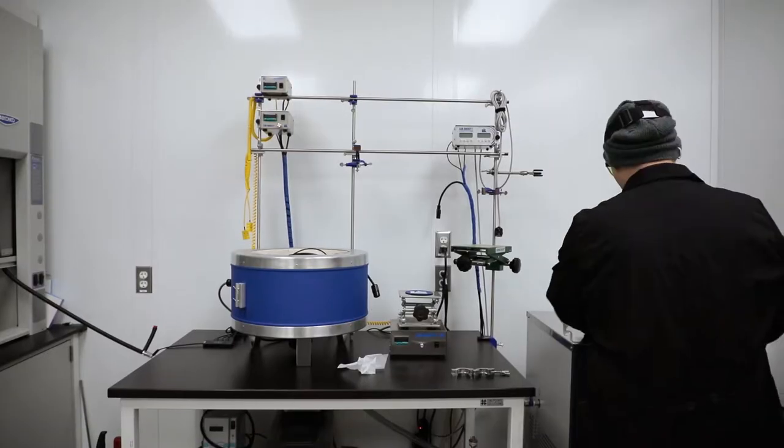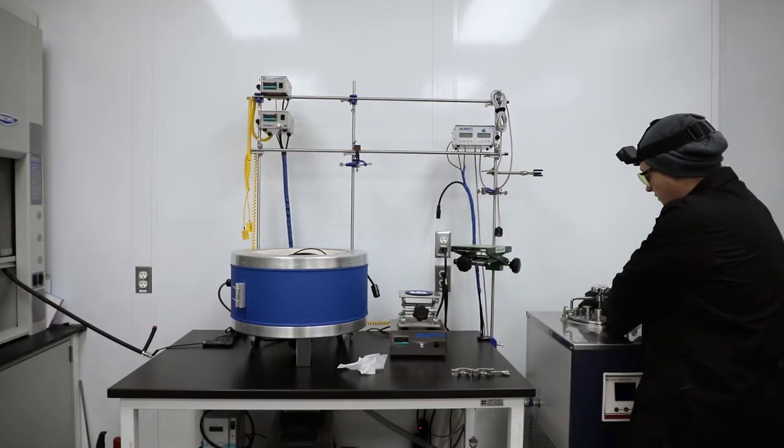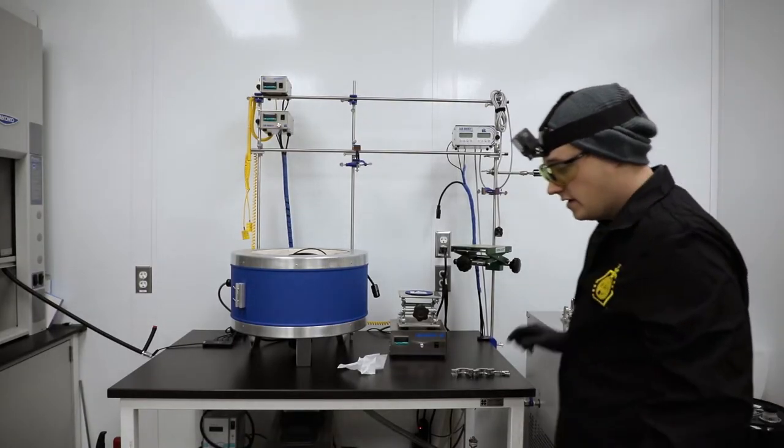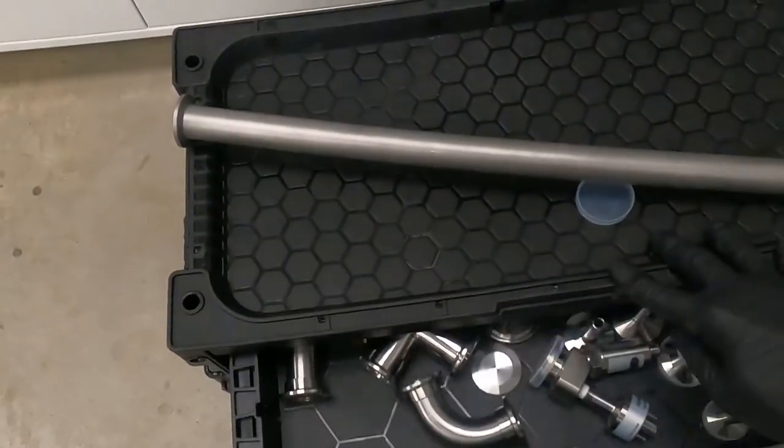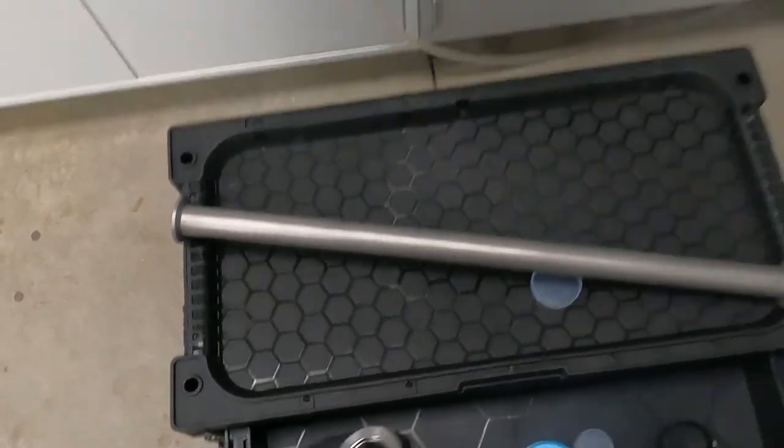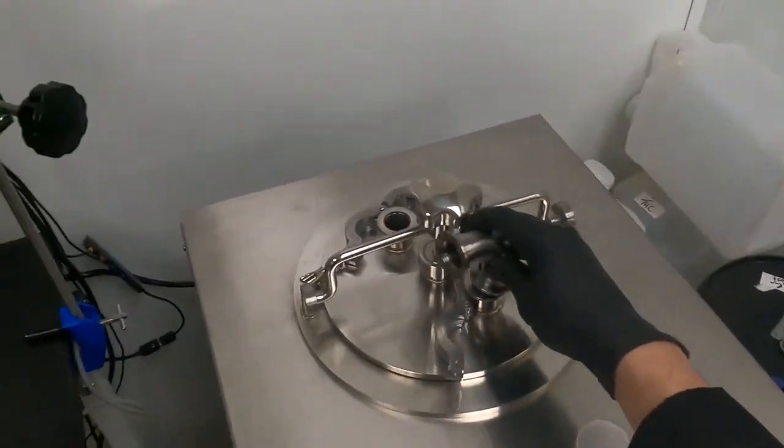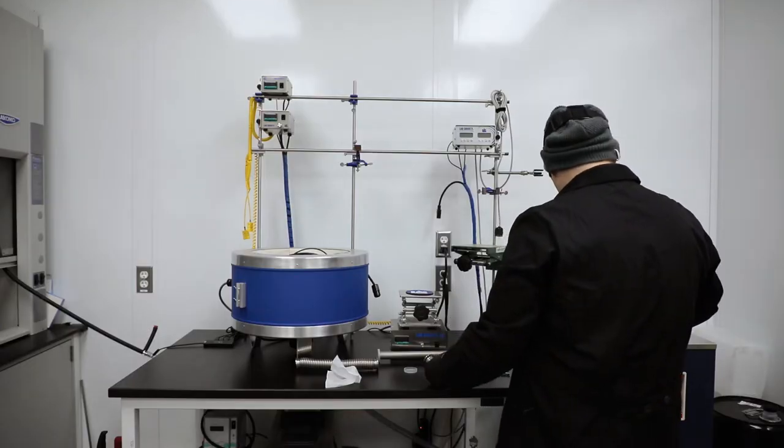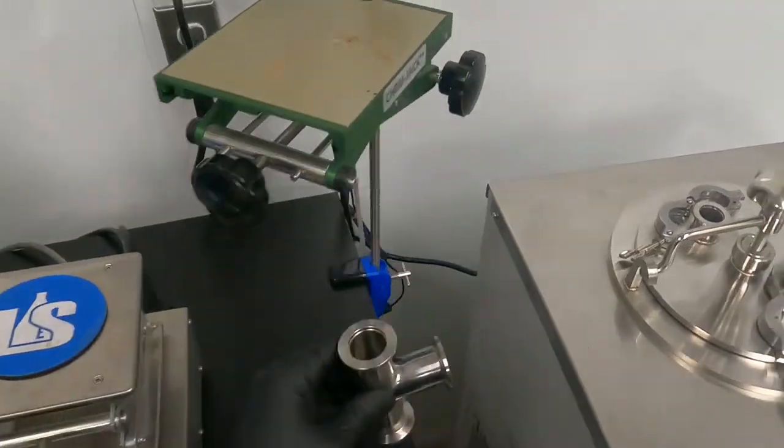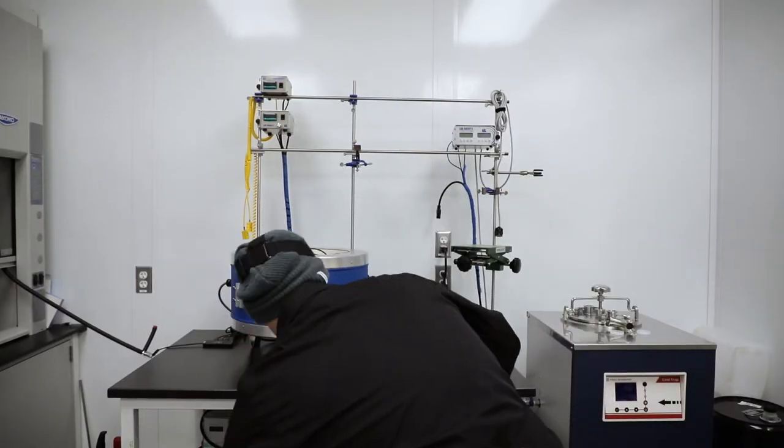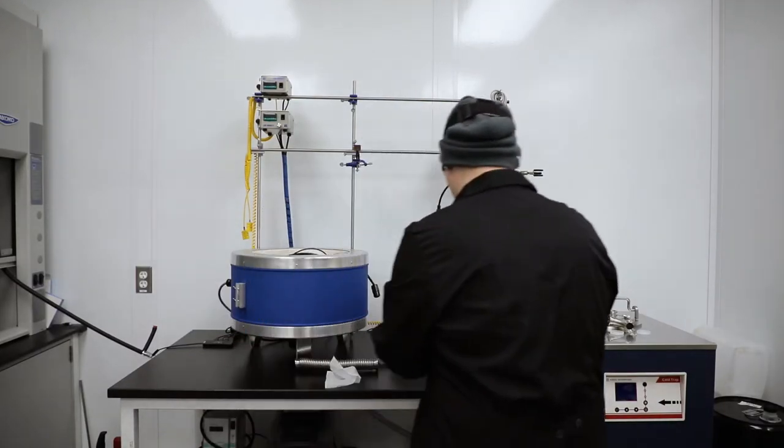So we're going to look over here at the T-80. Notice I've got these capped as well. I'm gonna go ahead and pull these off. And then hopefully I have two 90s. If I don't I can use a T with a cap. Looks like I don't have two 90s. So I'll probably put a 90 right here. And then at the top to make this turn I'll do a 90 with a cap.